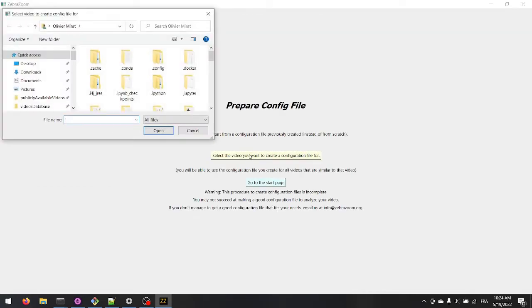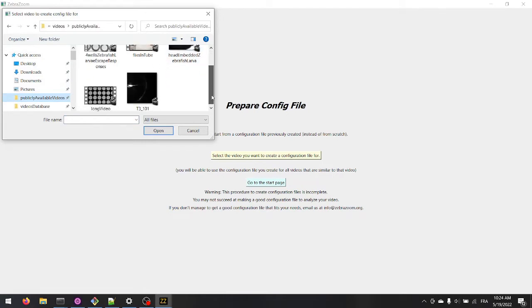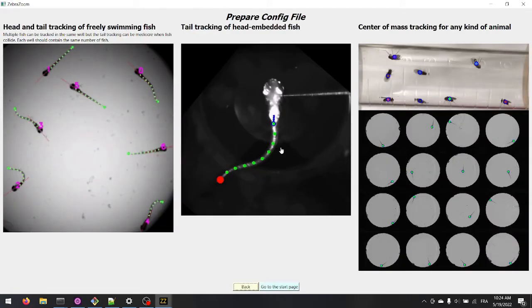First, select the video for which you want to create a configuration file. Here, we are choosing a video of poor quality, which is difficult to track. First, select the tail tracking for head embedded fish.